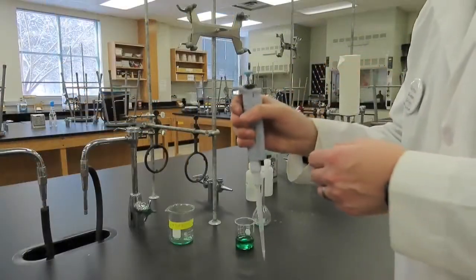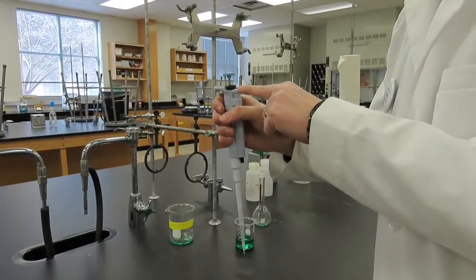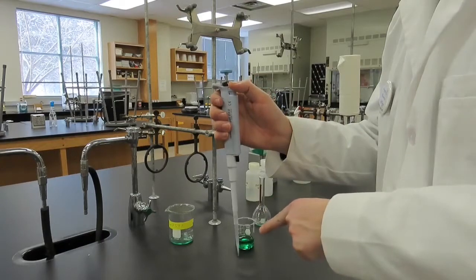When finished with the tip, press the ejector button located at the top of the micropipette to eject the tip into its proper waste receptacle.